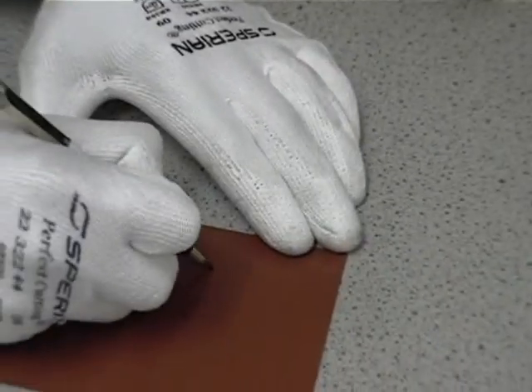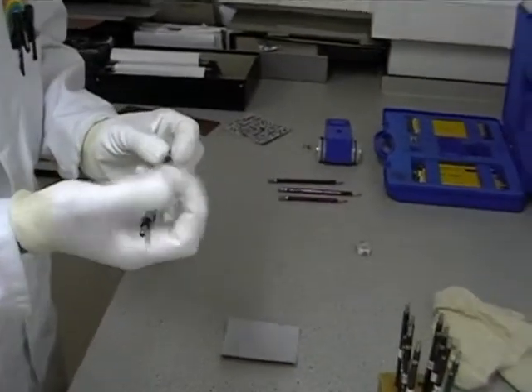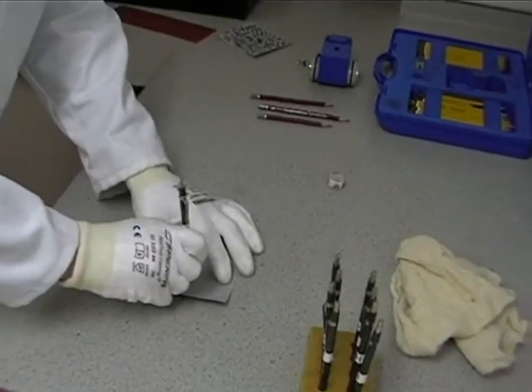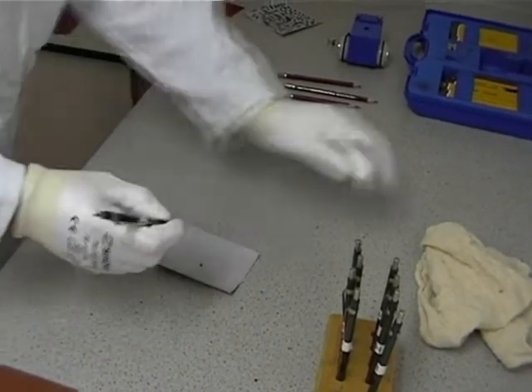For day-to-day measurements, a trained operator can perform the test by hand. Firstly, a pencil of a well-defined specification is prepared by sharpening and flattening the end.